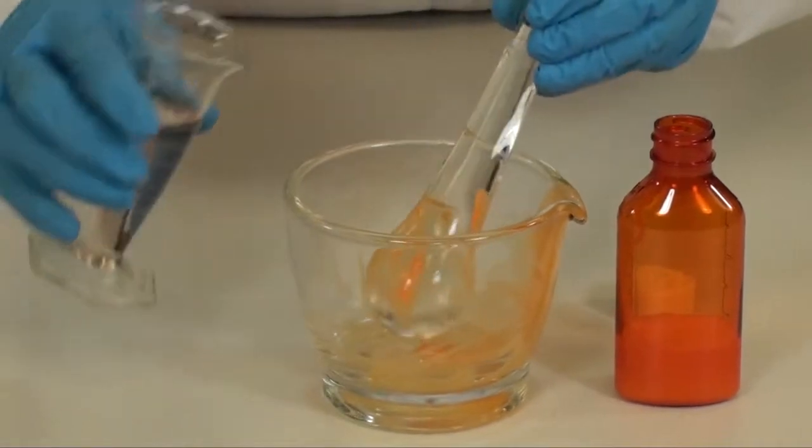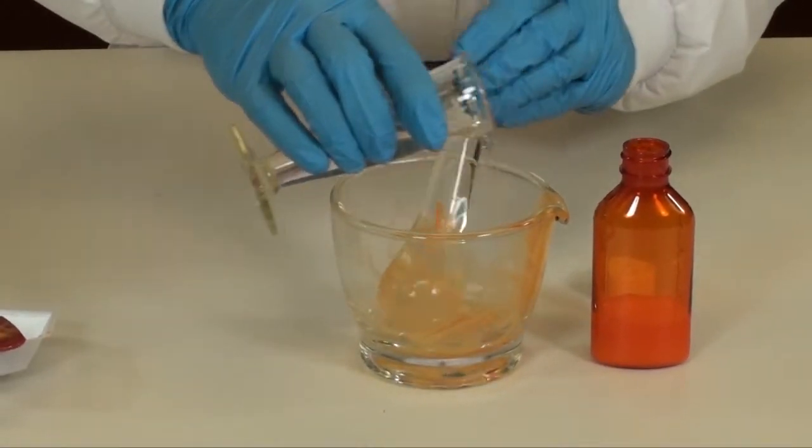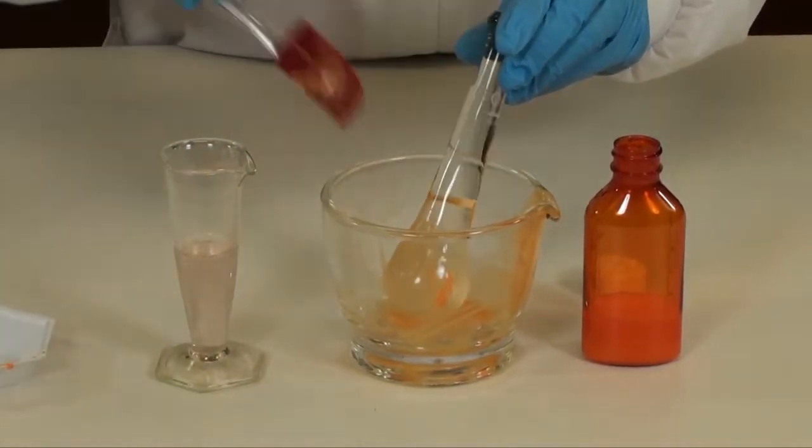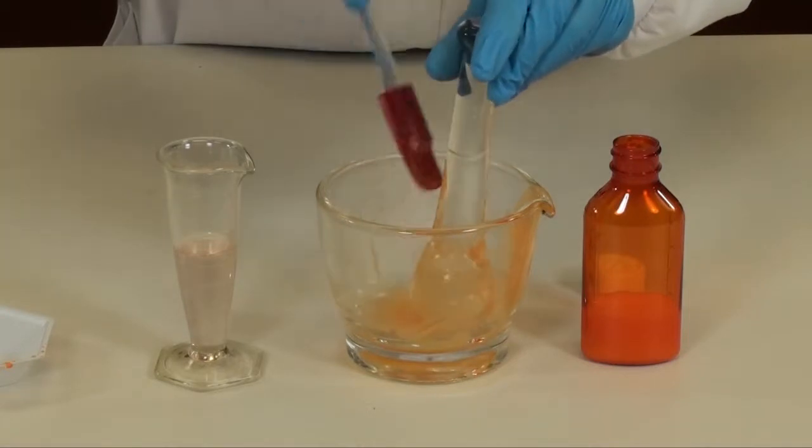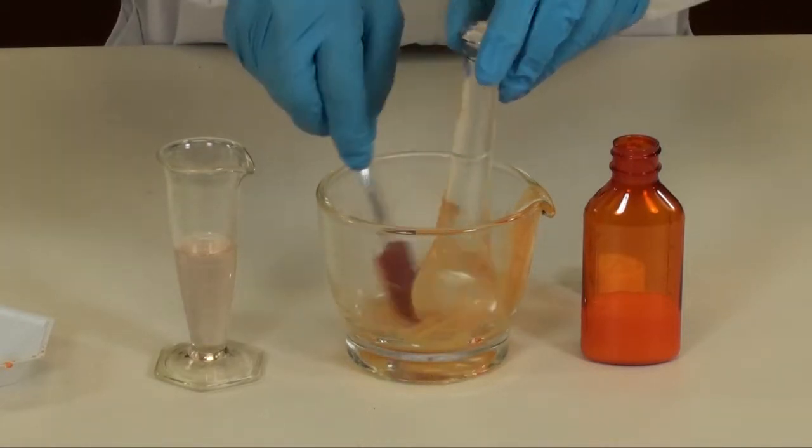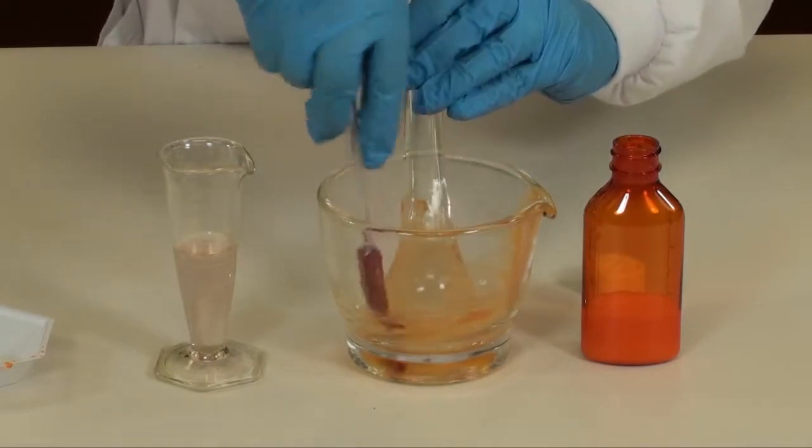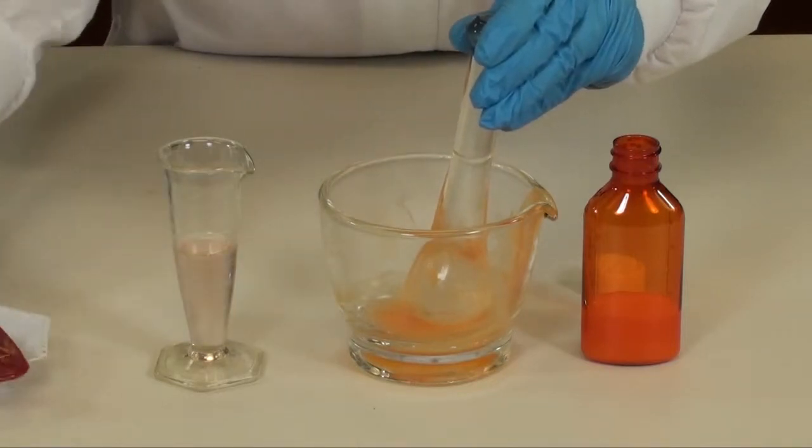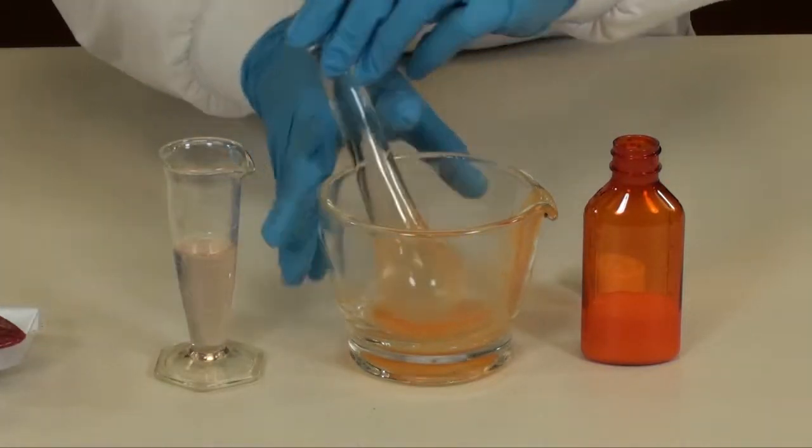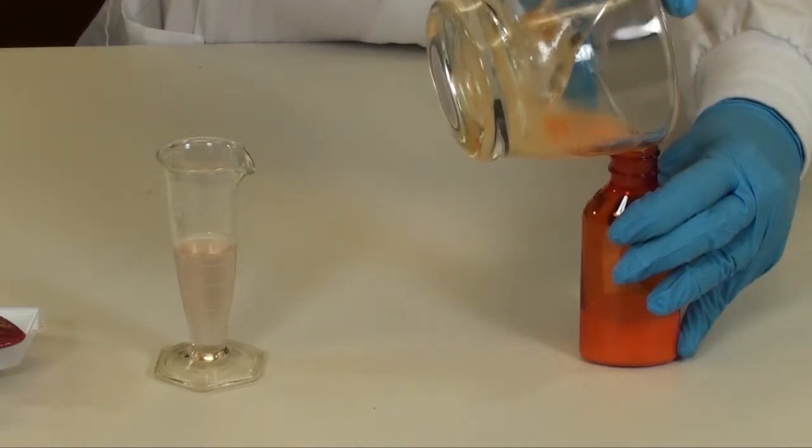Repeat the process until all the drug is rinsed from the mortar, the pestle, and your rubber spatula. In this particular product, when you don't see orange, you will know that you have rinsed all the drug from the mortar and pestle.